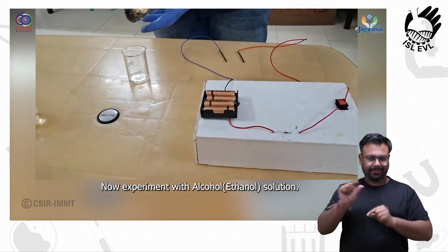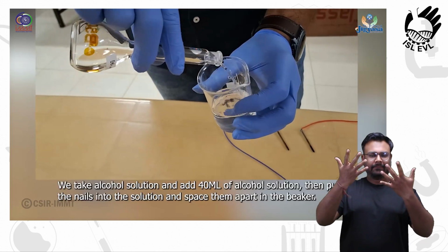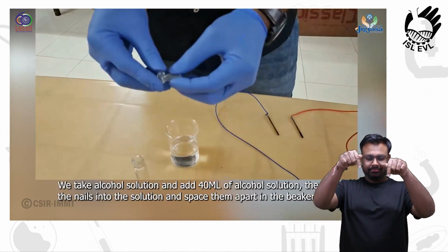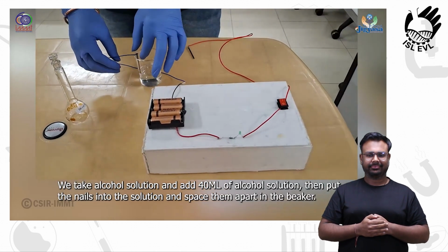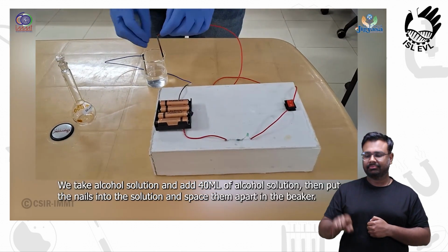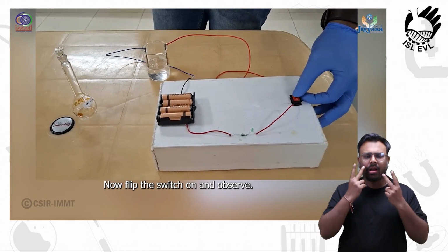Now experiment with alcohol solution. Now for the fourth solution, we take alcohol solution and add 40 ml of alcohol solution. Then put the nails into the solution and space them apart in the beaker. Now flip the switch on and observe.